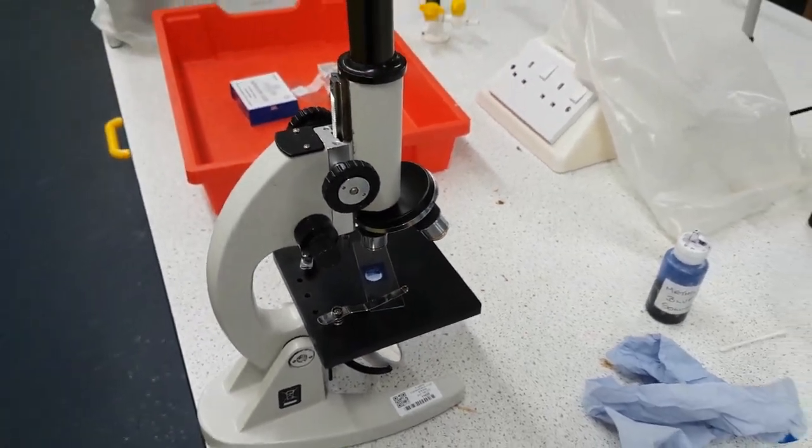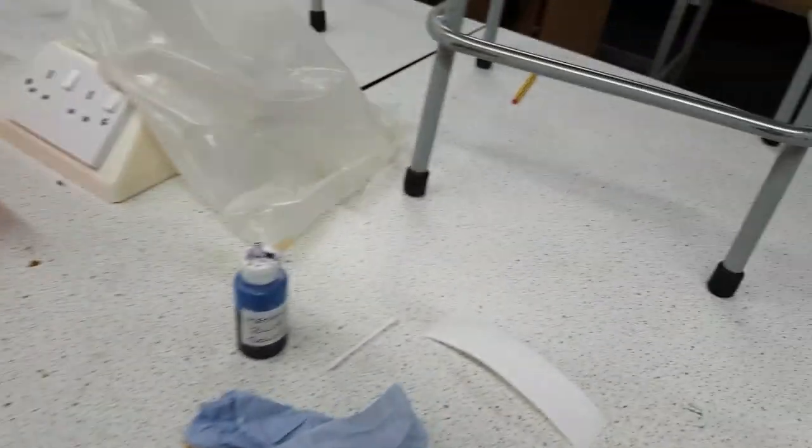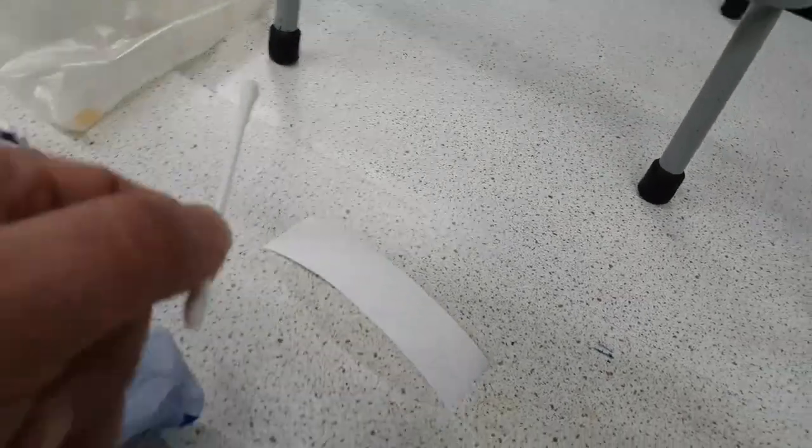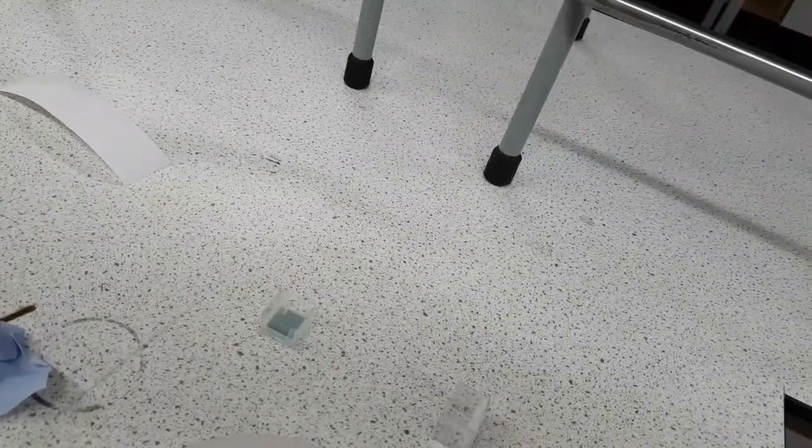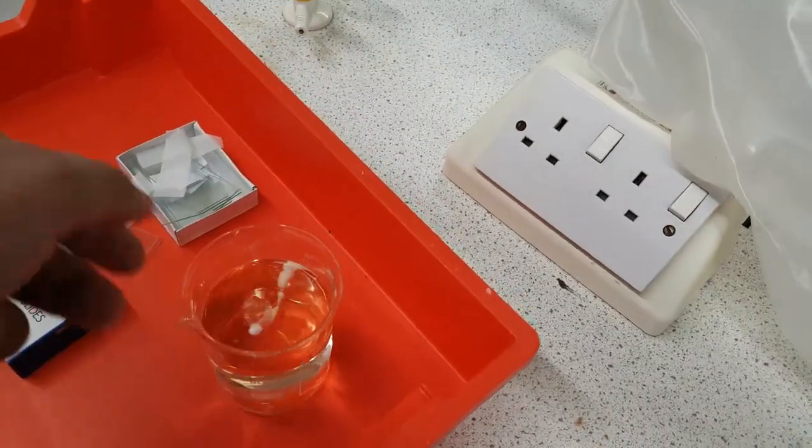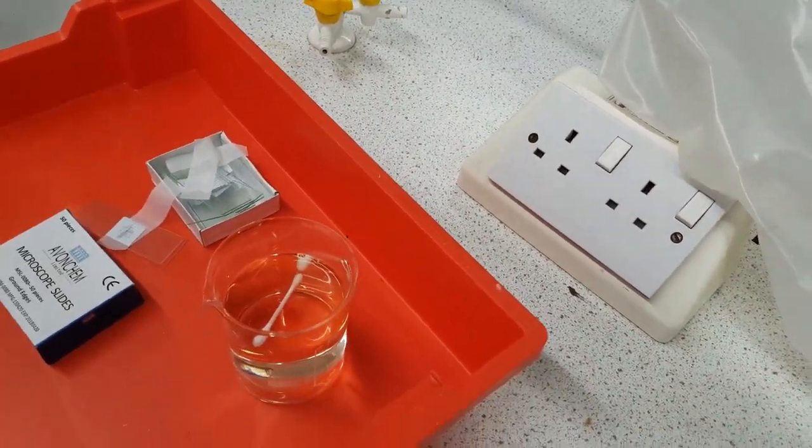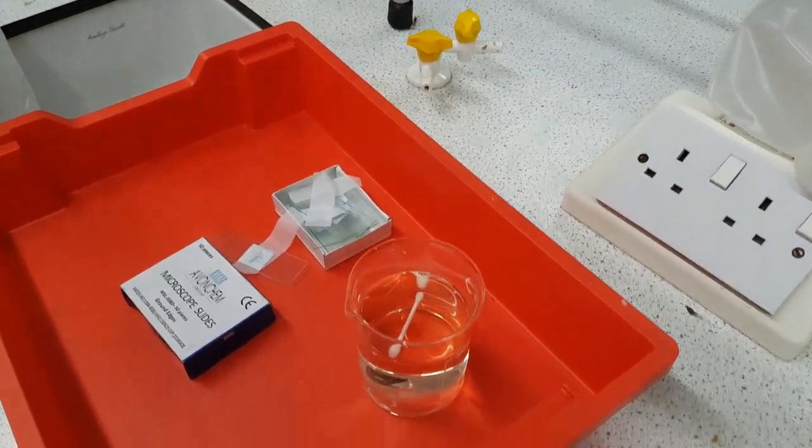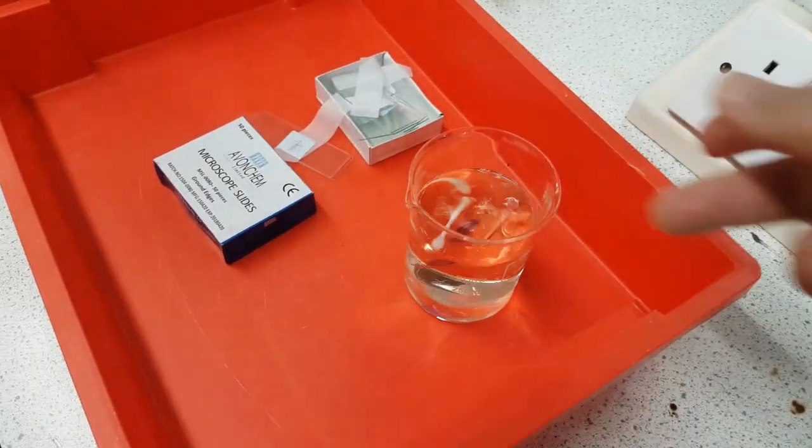Now once you're done with everything, here as soon as you've done the swab so you shouldn't really leave it hanging around how I did, as soon as you've done it you place it in the disinfectant. So you place it in the disinfectant, you take your cheek cells once you're done you place that in the disinfectant as well.